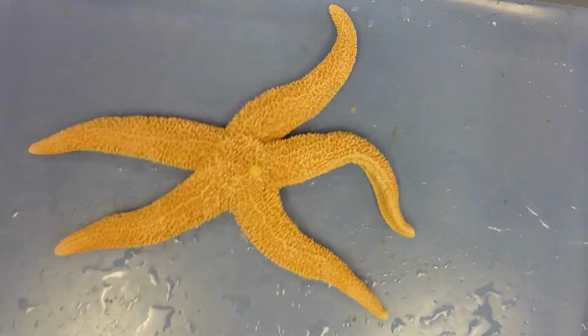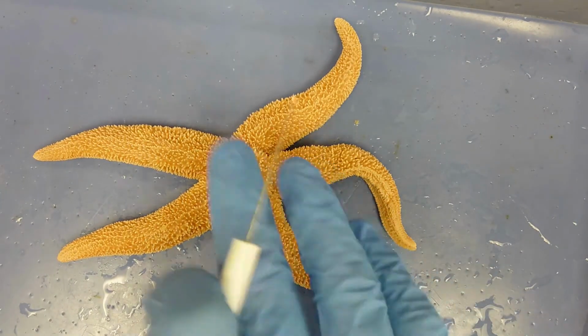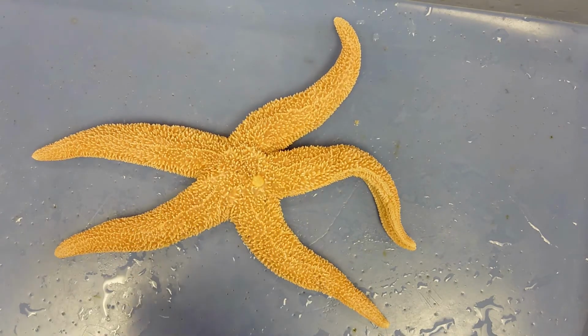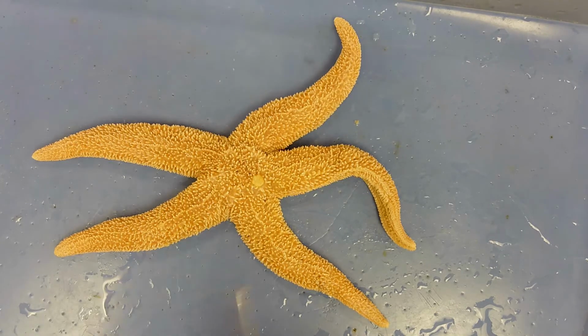The way I'll set this video up is I'll use the specimens I had in Thursday's lab. I had this specimen here, and then I had a dissected specimen where you could see the water vascular system as well. So I'll go through external anatomy first, and then we'll dive into internal anatomy.